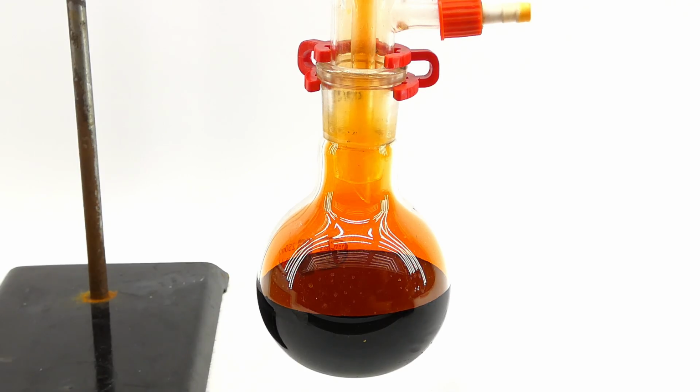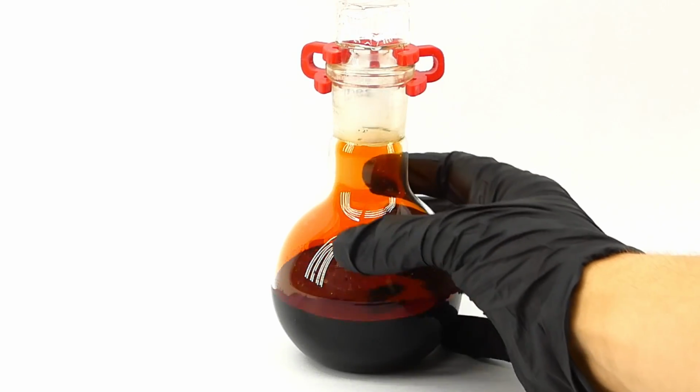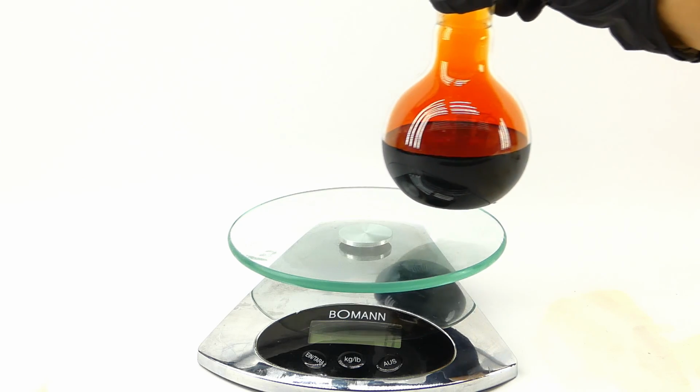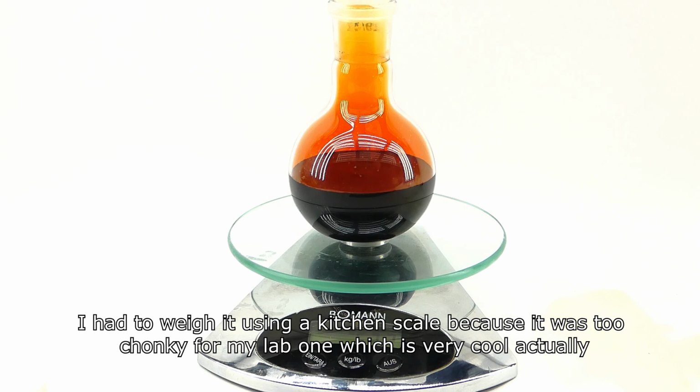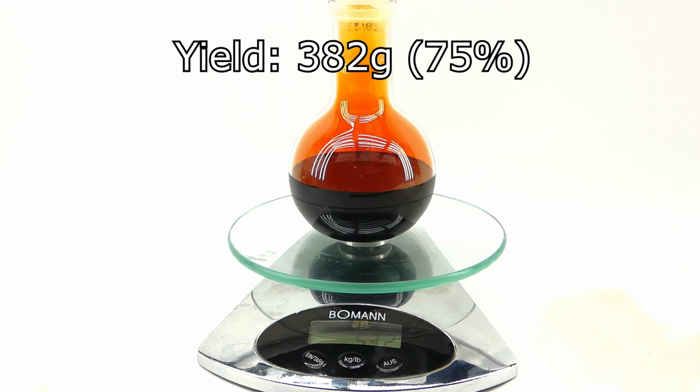I let everything cool down and disassembled the apparatus, and in the end I was left with half a flask of extremely pure bromine. When it comes to the yield, I managed to get 382 grams of it, which corresponds to a percent yield of around 75%, which is very good and will be plenty for my project.